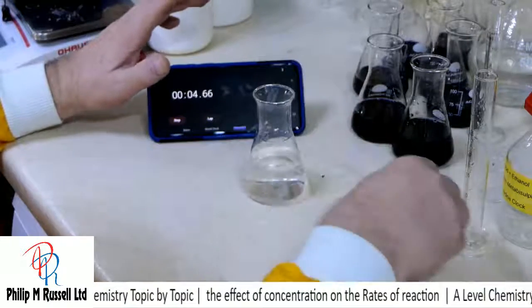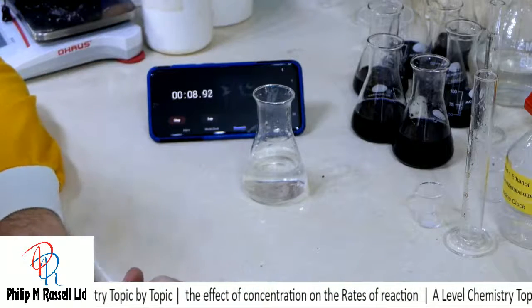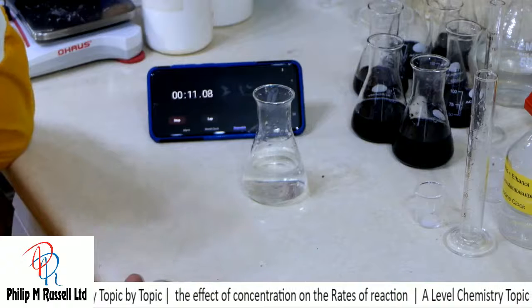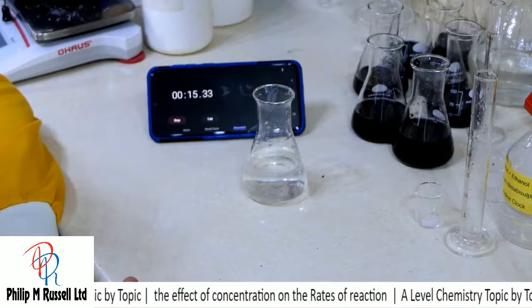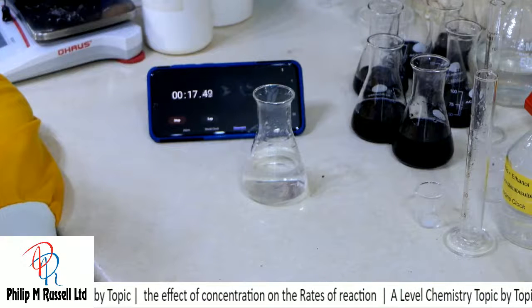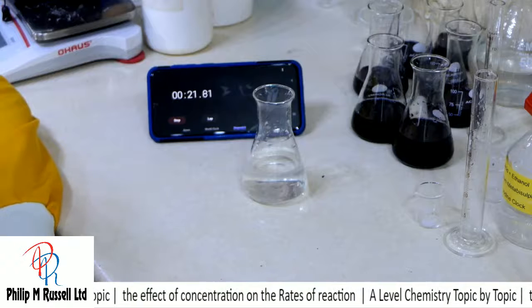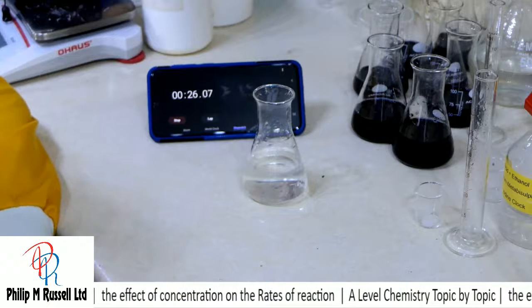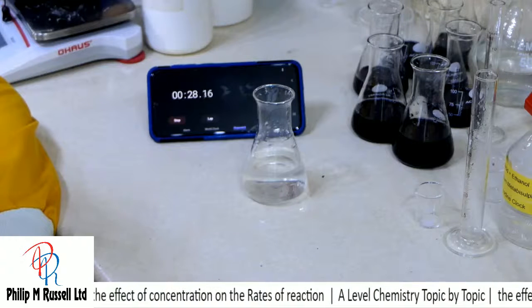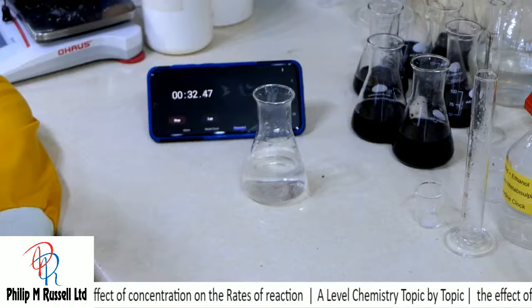So how long is this one going to last? Well, we should be up to about 45 seconds, I think, that sort of time, 45, 50. Much cooler when you've got lots of these all set up doing a party trick, but it still makes it a really good fun reaction to do.